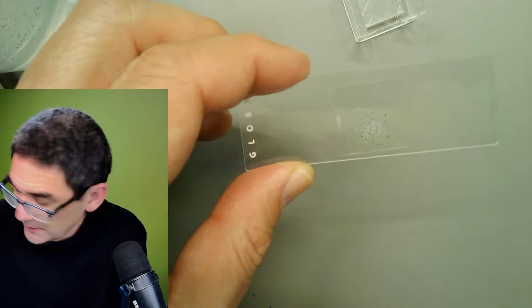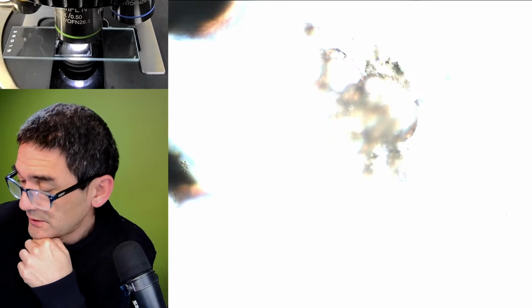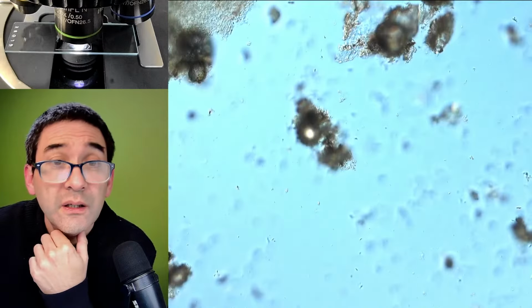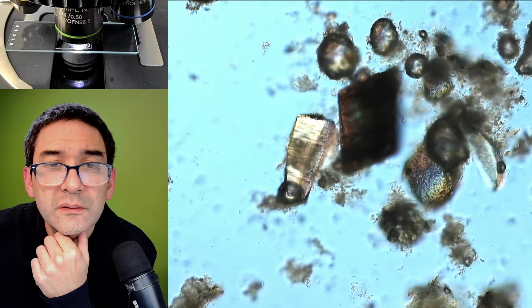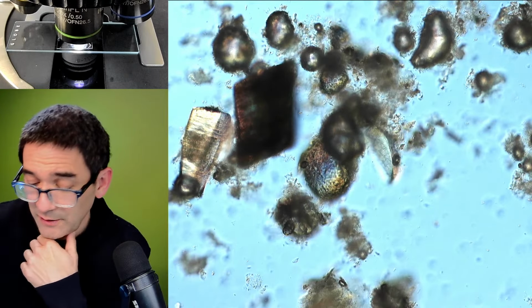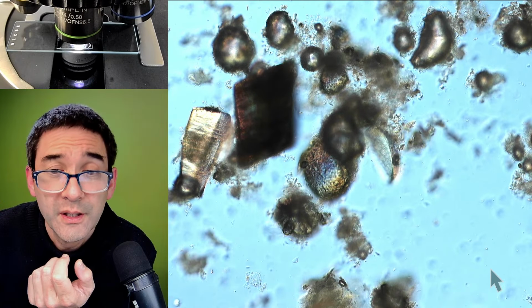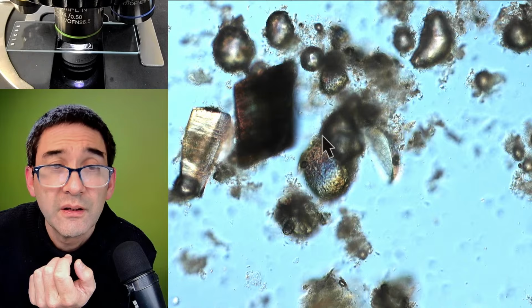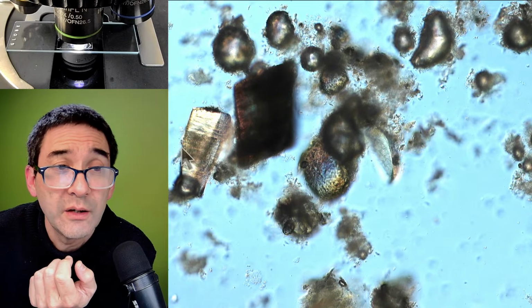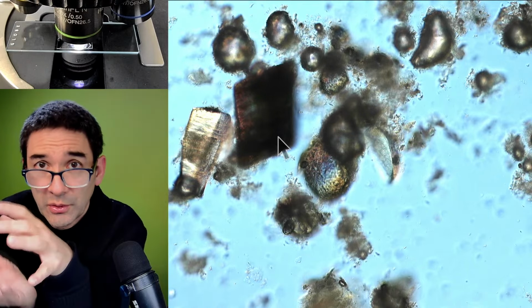Okay, so let me remove this here again. Let's put it into the microscope again. Where is the scope view? It's a little too bright. Oh yeah. So this, for example, is a hair, but it's seen from the side. I just show you that this is going to be a little bit a question of luck of whether we're able to find something. So this here is seen from the side, right? So the hair is extending out like this, and I hope that I'm able to find one that's turned 90 degrees.